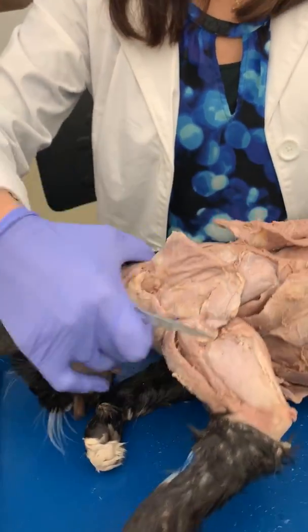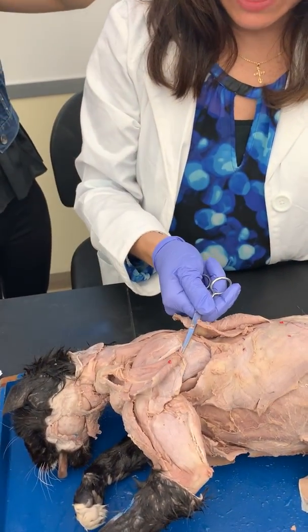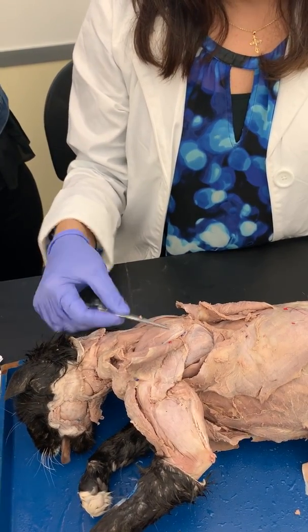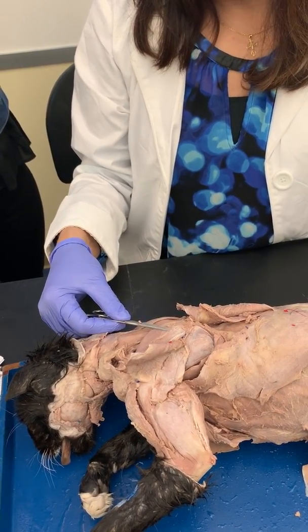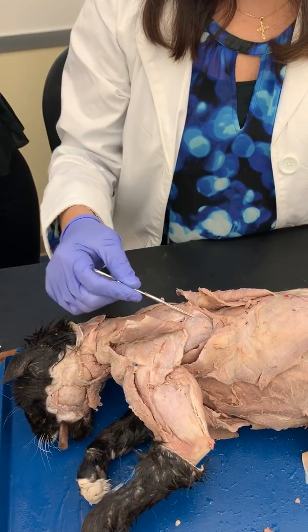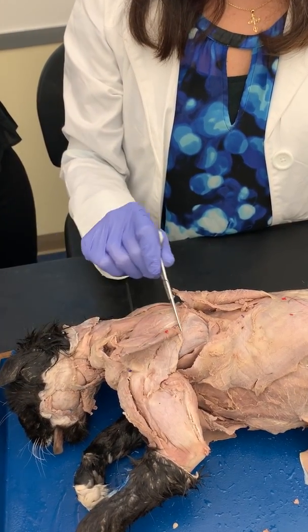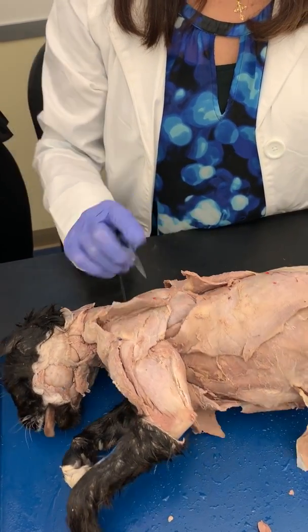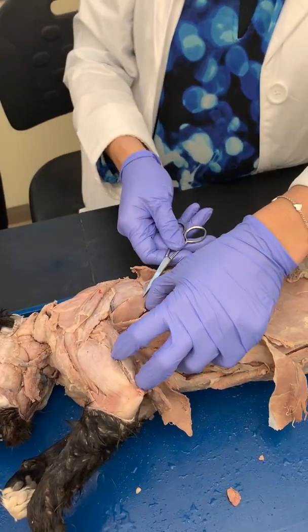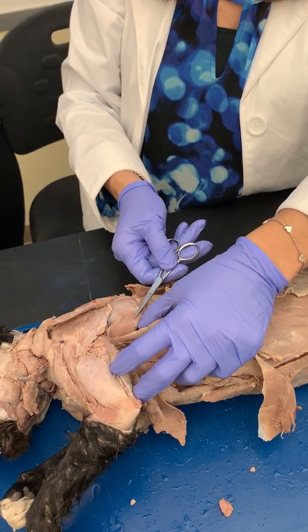The middle of the back, if we retract the acromial trapezius, you can see that it anchors at the spine of the, what is this called, guys? Scapula? Scapula, okay. So the spine of the scapula. Above the spine, you have your supraspinatus. Below the spine, you have your infraspinatus. And then you have this muscle right down here under the latissimus dorsi that comes up from the scapula. This is your teres major.